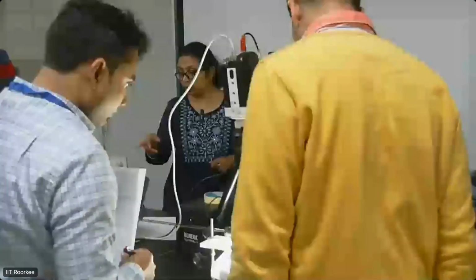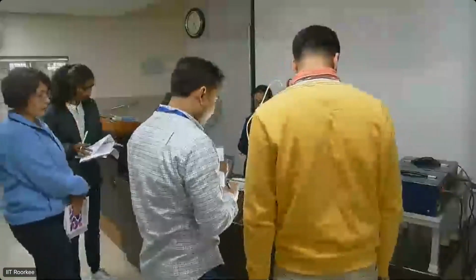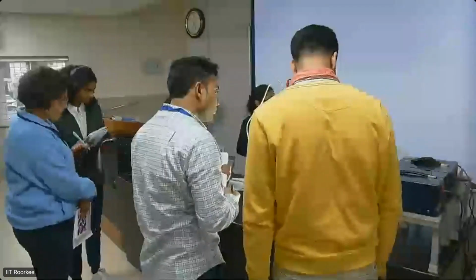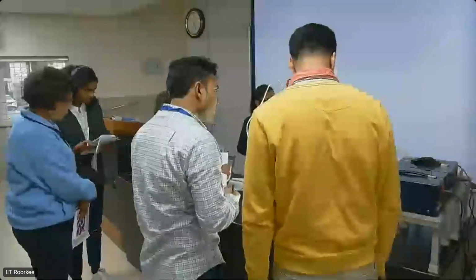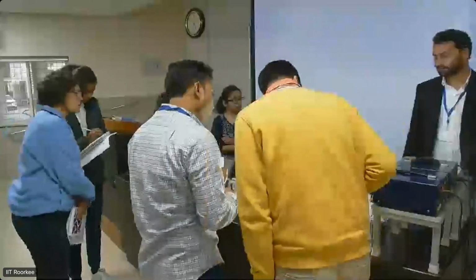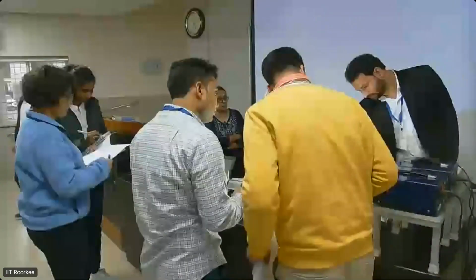Let's look at this camera also. This is for toluene.